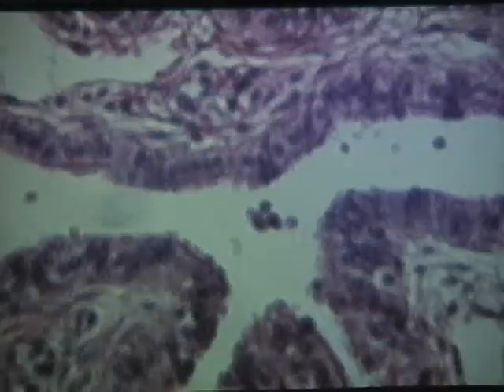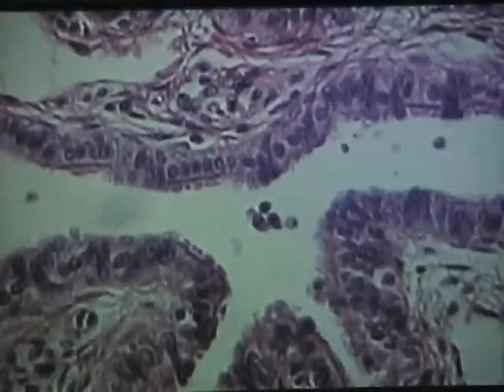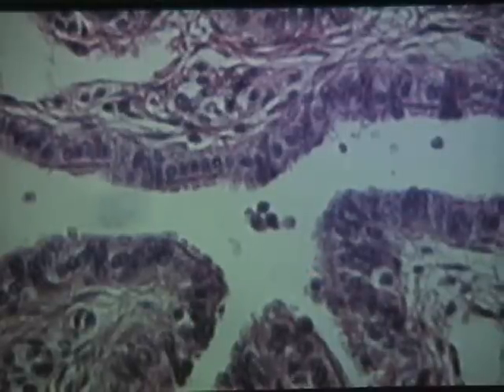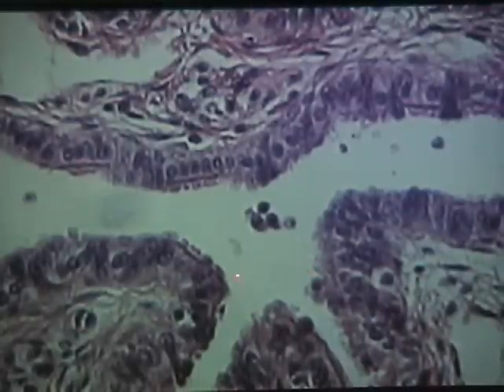I'm going to attempt to make a minor focus adjustment here. Now, while these look like cilia, these don't. What I see here looks to me just like a rough surface. And quite often when you're looking at the fallopian tube, the cilia do not stand out. What you get is simply something that appears as though the free surface of the epithelial tissue is rough rather than smooth. These are fairly obvious along here.